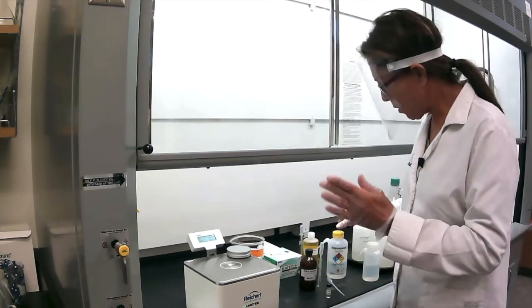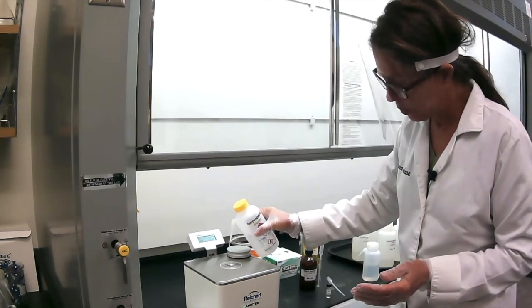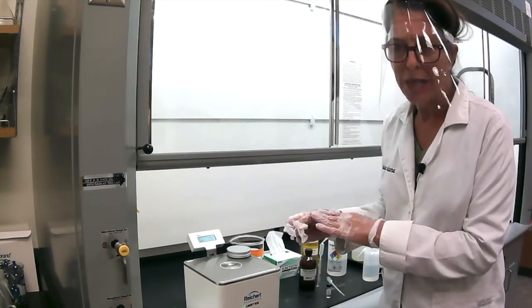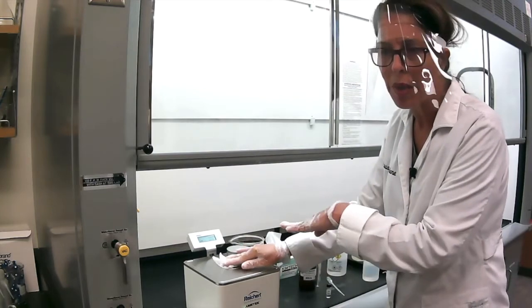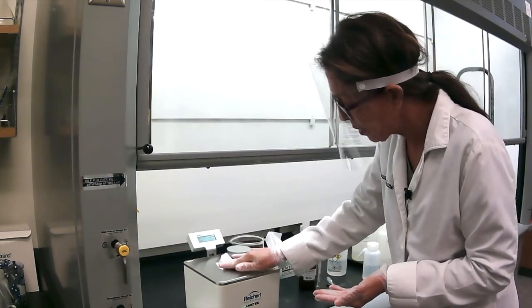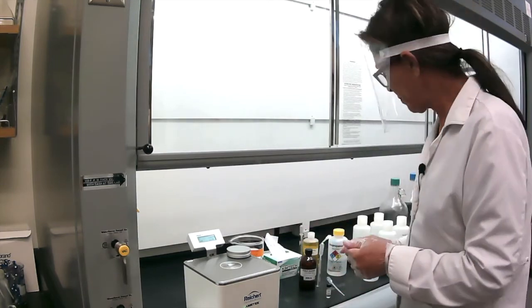First of all, make sure you have a clean surface. So how do we clean it? We usually use a few drops of isopropanol and then use Kim wipes. Why Kim wipes? This is a paper that doesn't scratch the surface, because the whole measurement is based on how smooth that glass surface is, because if you scratch it, you're going to have distorted results. So we're going to clean it very well with some isopropanol. And the good thing about isopropanol in the fume hood is that it evaporates quickly, so you don't have to wait too long to make sure that it's clean.